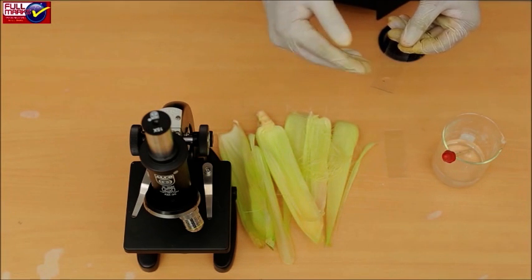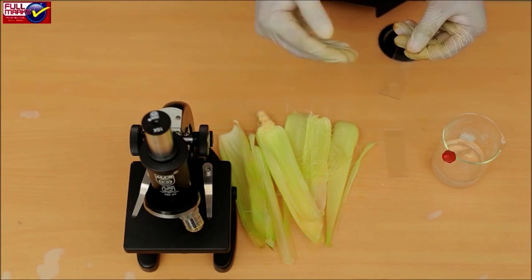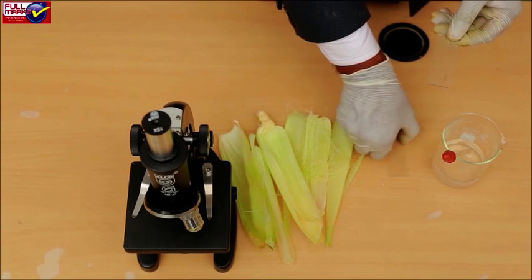Now observe the prepared slide of pollen grains under a microscope to study its structure.